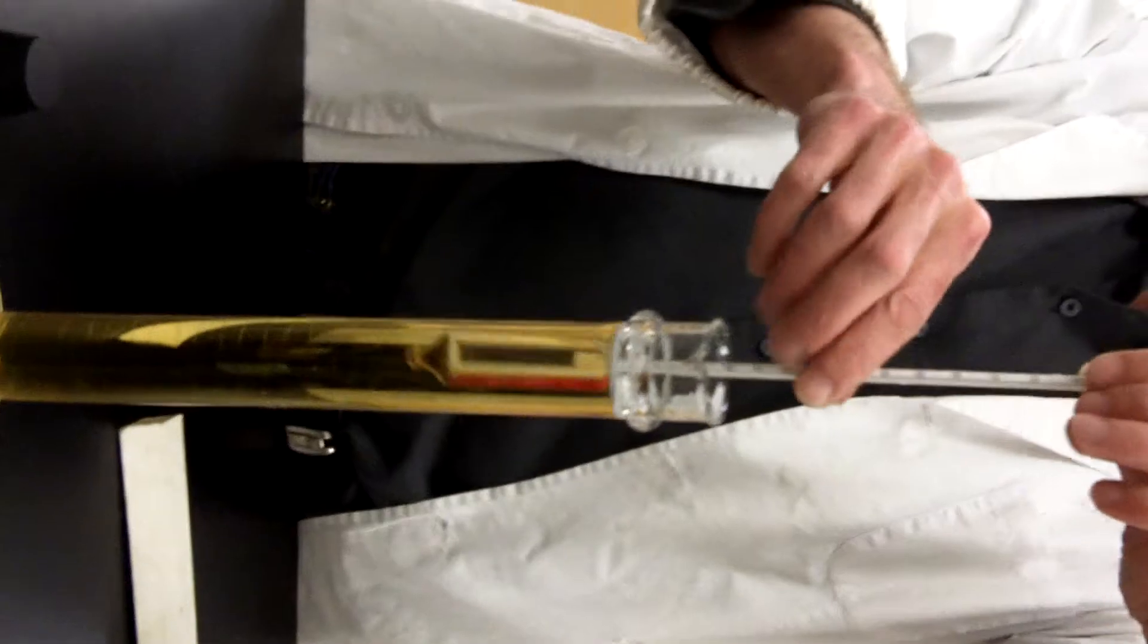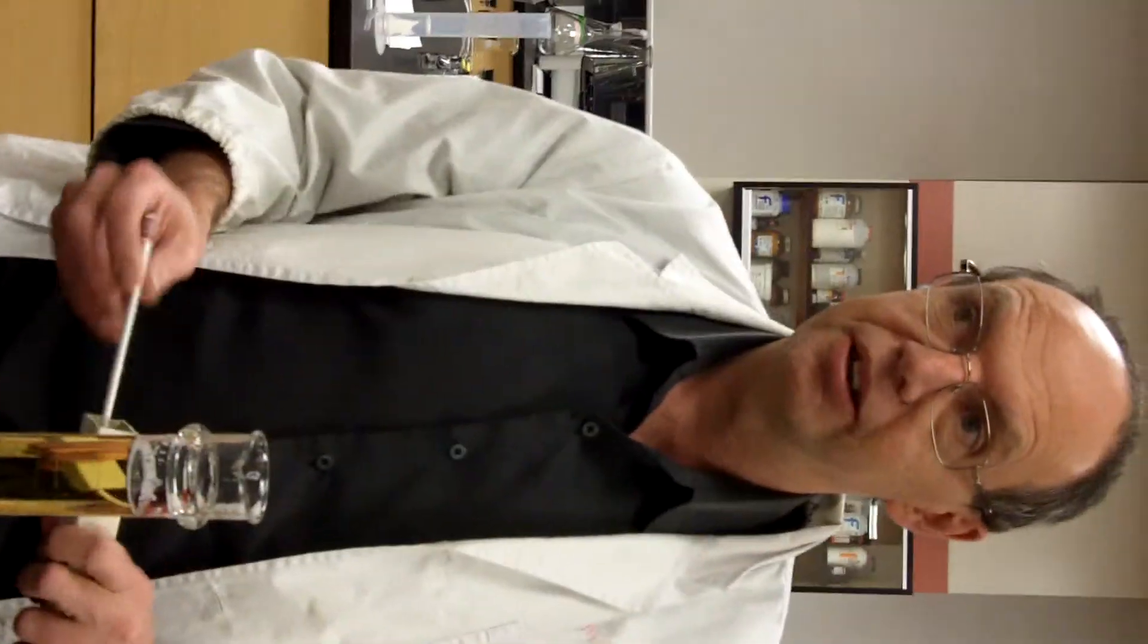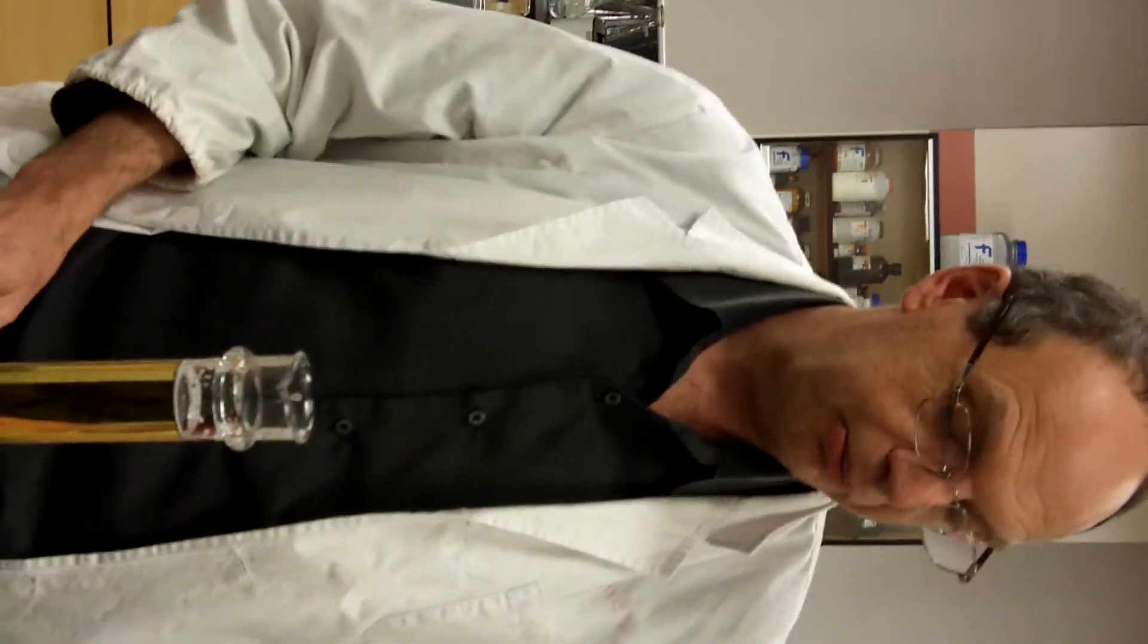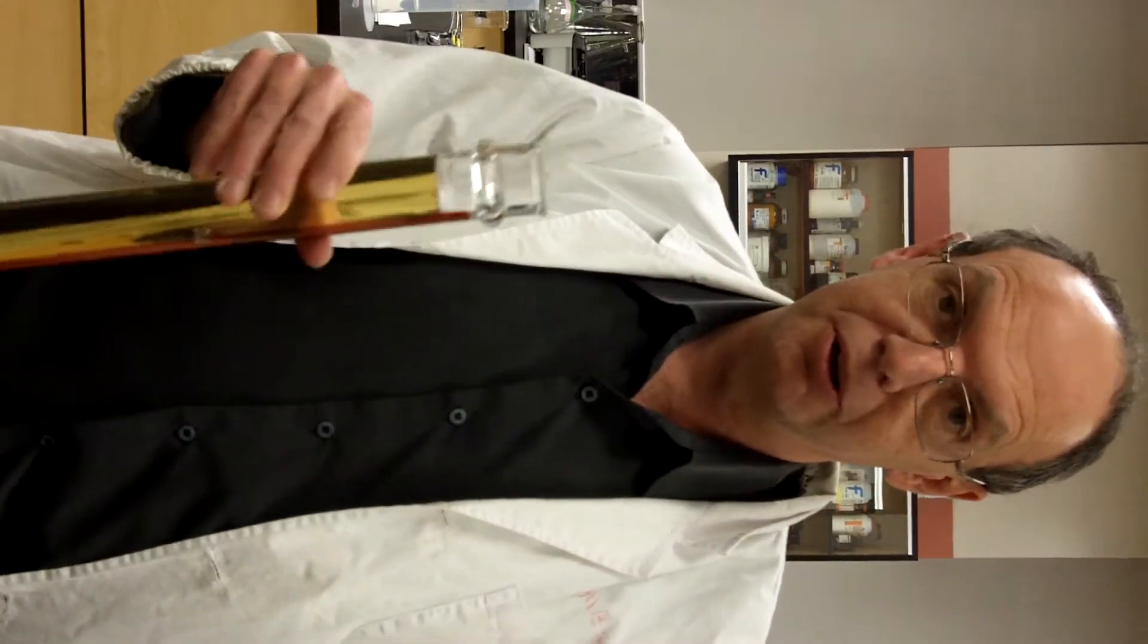And as I mentioned, you actually do the same for the water, which we won't do at the moment because we're pressed for time. So do the beer and the water, and record the temperature, and record the specific gravity.